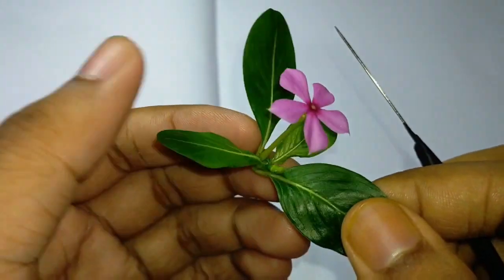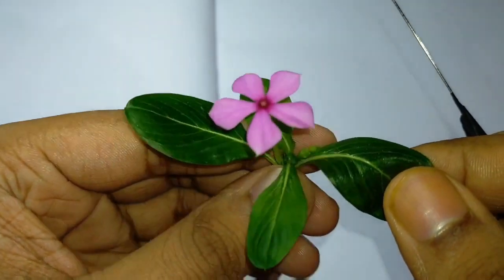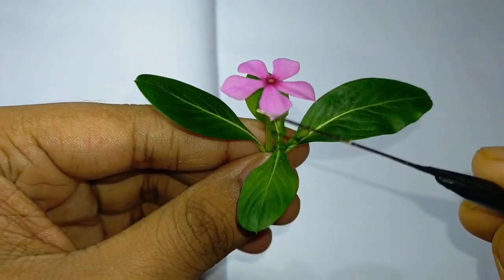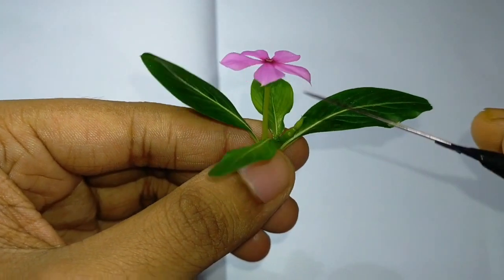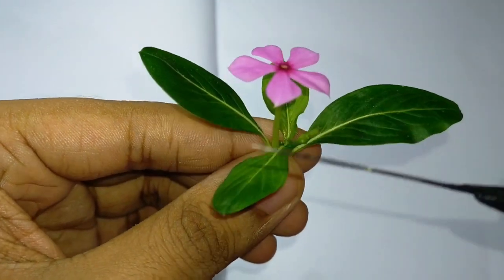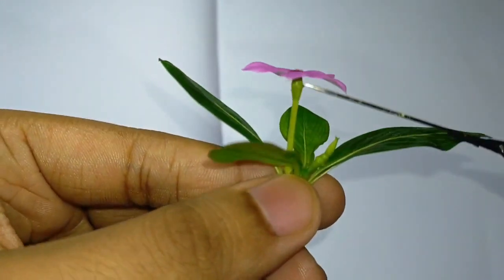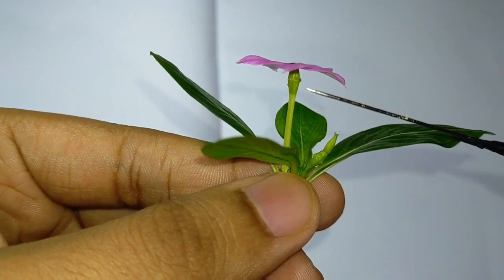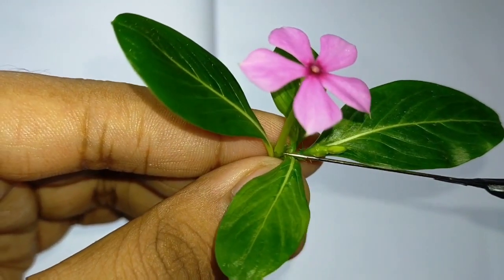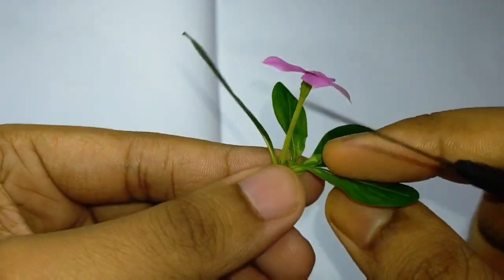It bears five petals, it is pentamerous, and variously colored with a sweet smell. Now I will divide the flower into four parts: calyx, corolla, androecium, and gynoecium. First, the calyx.